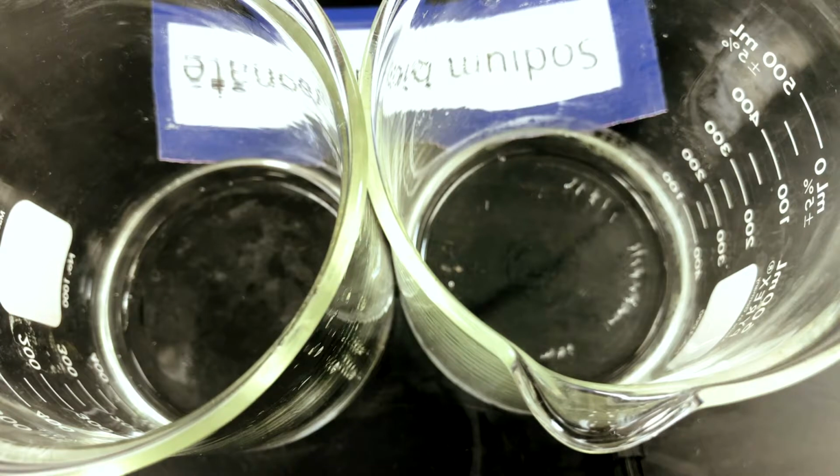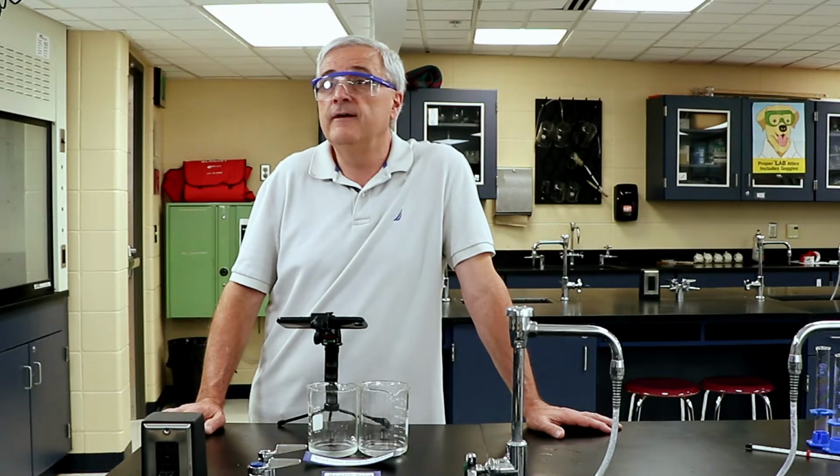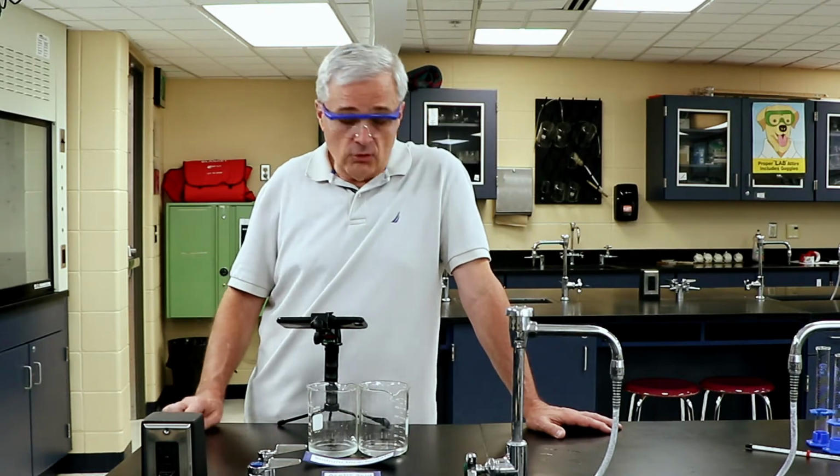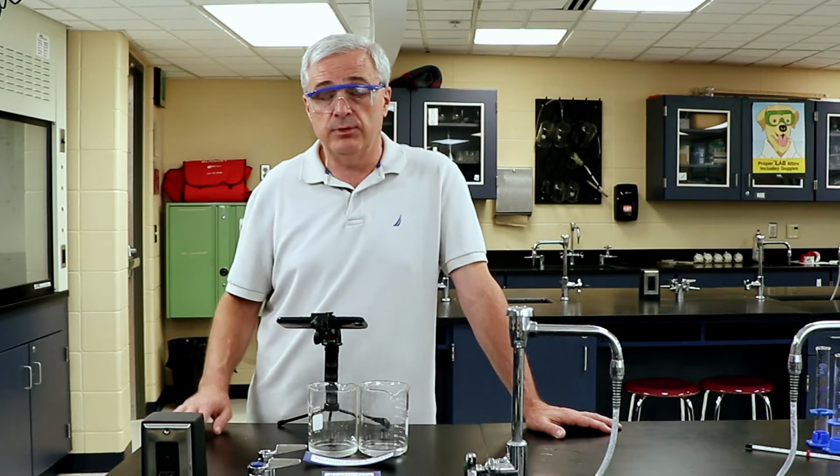And if that is the case, if the difference between the times is notable, there's a statistical procedure called significance. We're not going to say significant, but if the difference is pretty impressive, we're going to conclude that our hypothesis is correct. We are now coming up on 4 minutes, and this reaction is still taking place.